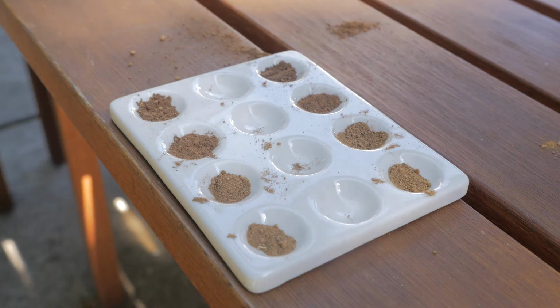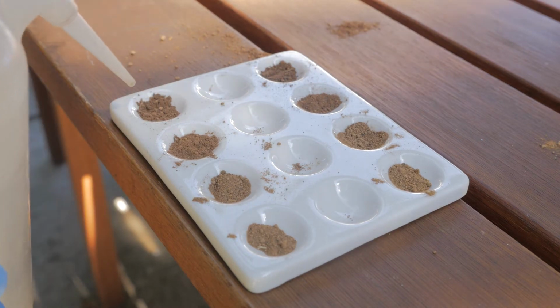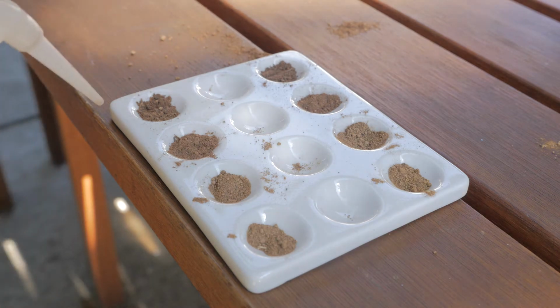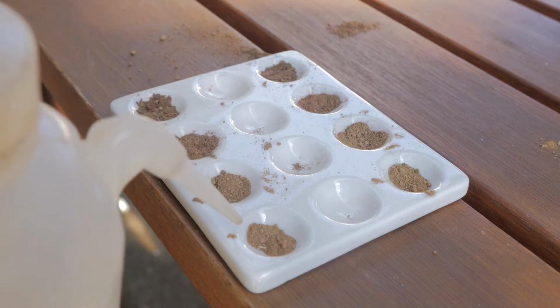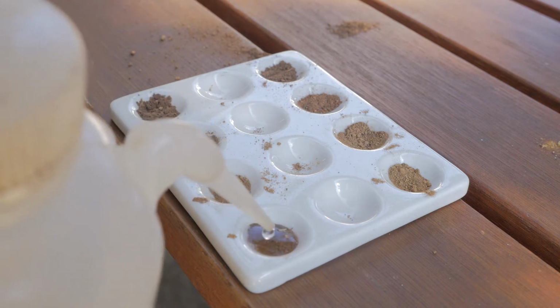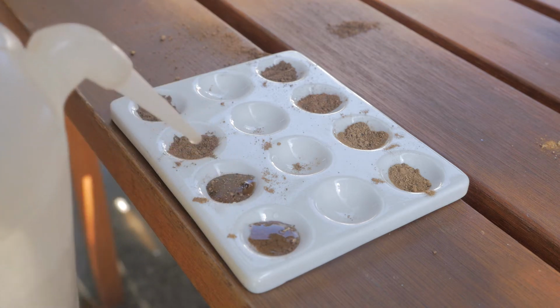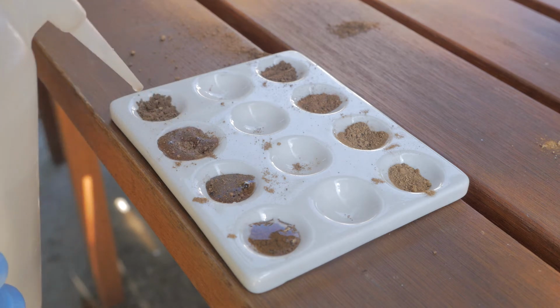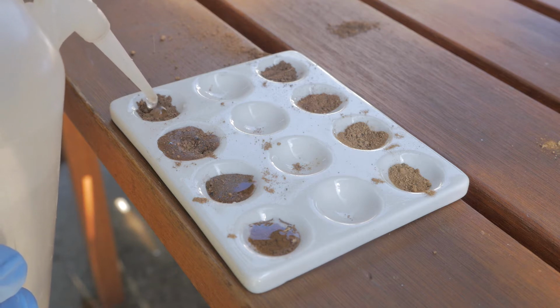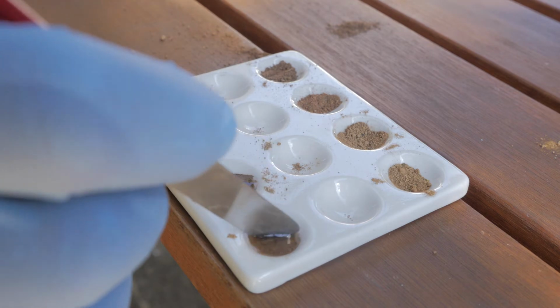Are we rolling? Okay, so first we're going to do the 1-to-1 water. These are the top of the mineral horizon for that second soil in the high elevation volcanic transect. So we'll add just a little bit of water in there, roughly 1-to-1. Those organics are reacting pretty heavy. We'll give this a little stir.